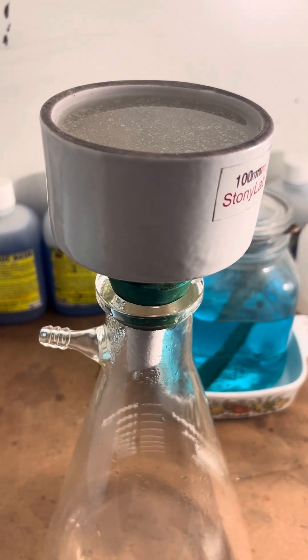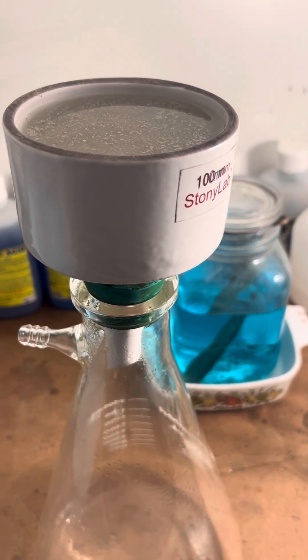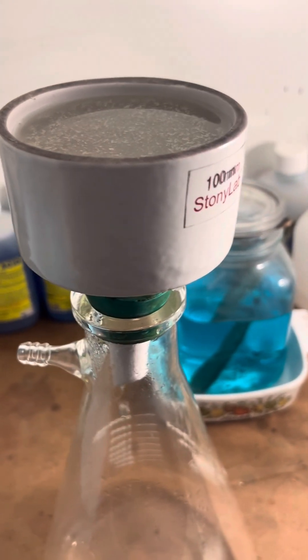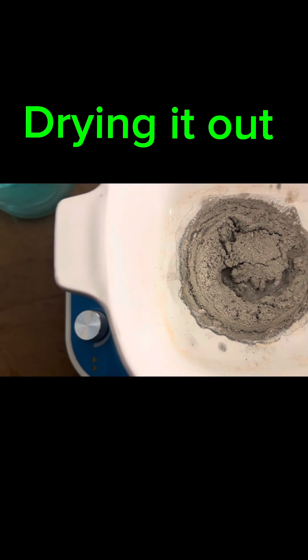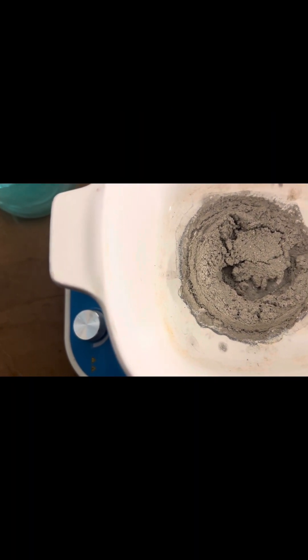We're almost finished cleaning this up. I'm going to finish running these two cups of boiled distilled water through here. We might be drying this out tonight. This is the cemented silver we're drying out — we'll get a weight on it a little later. It's still just a little damp, so we'll dry it out completely and then get a weight on it.